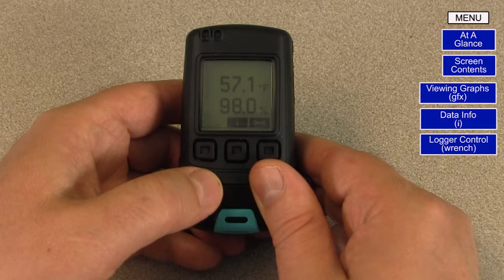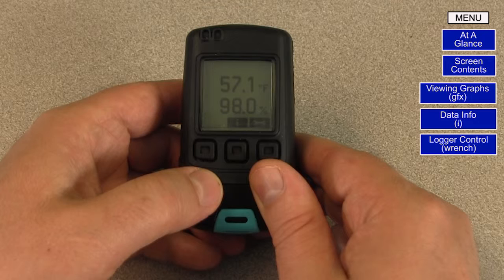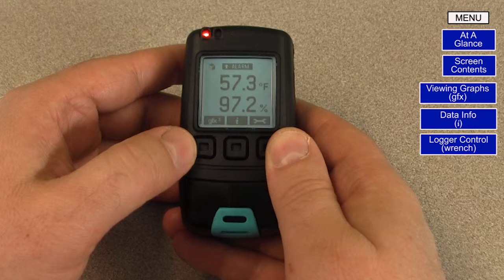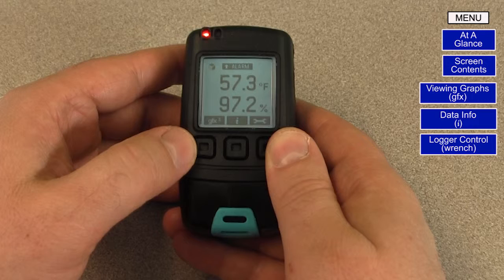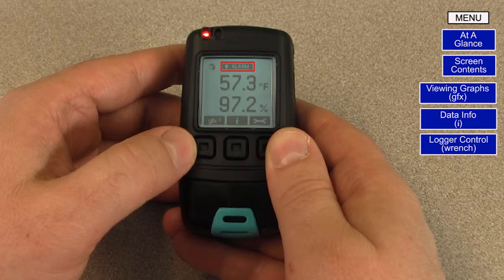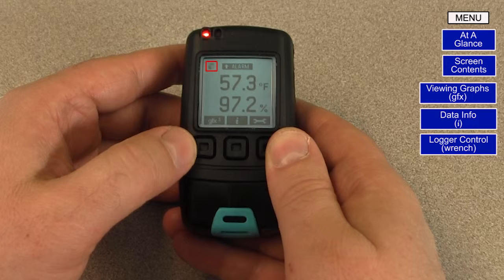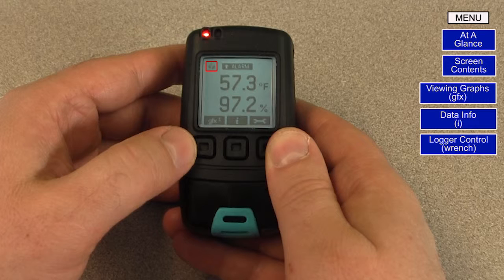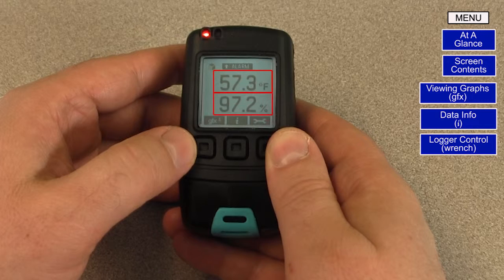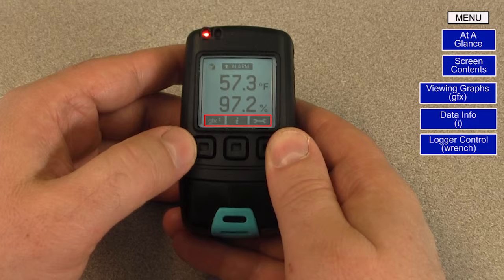Had I selected the option to keep the LCD on with the backlight lit for a short time, I would see the contents on the screen but there would be no backlight to make it easier to see. Let's freeze the image so that we can take our time reviewing the contents on the screen. Going back to the alarm — in addition to the LED light, I see a box in the top middle of the screen with an arrow pointing up, meaning the high temperature alarm has been activated. If the low temperature alarm was activated, the arrow would be pointing down. If the Easy Log cube is spinning in the top left corner, your logger is logging. A battery icon will appear when the battery is starting to run low. I see the current temperature and current humidity level, and three icons at the bottom: one with the letters GFX, one with the italicized letter I, and a wrench.